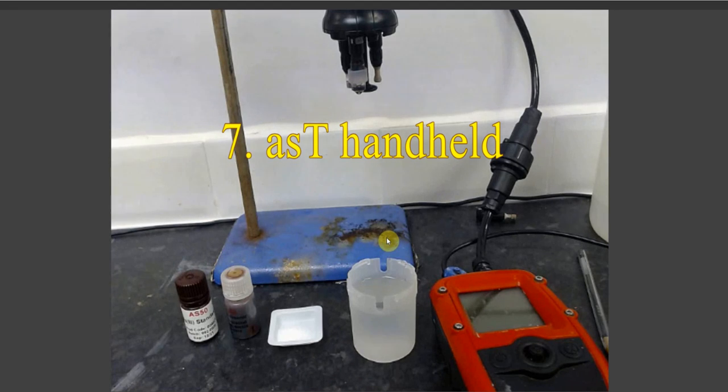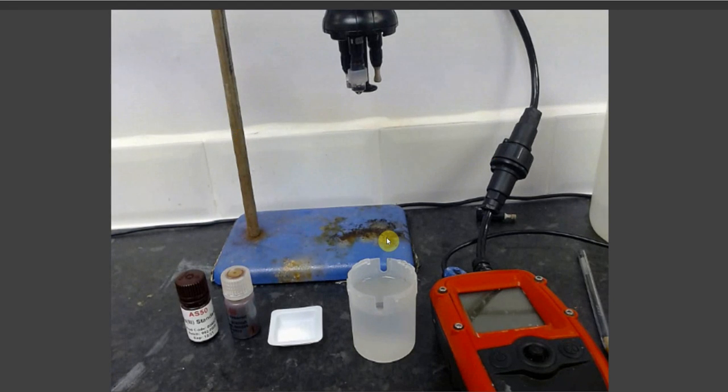For the single point standard addition analysis of arsenic on the Metalyser handheld unit, you will need your AS50 standard, your AS2 arsenic preparation solution, 2.5 grams of AS1 buffer and 70 milliliters of your sample water, alongside the Metalyser unit itself and the conditioned electrodes.